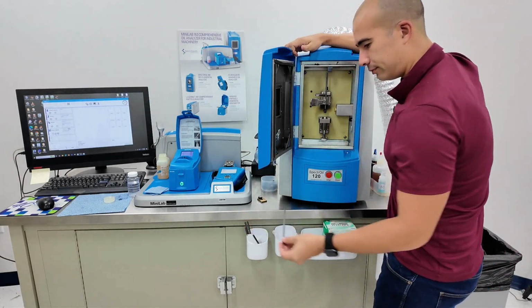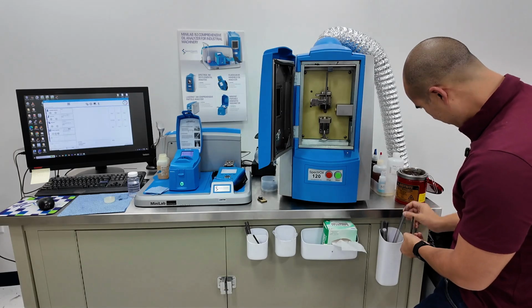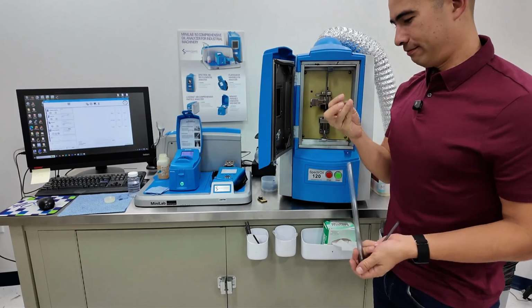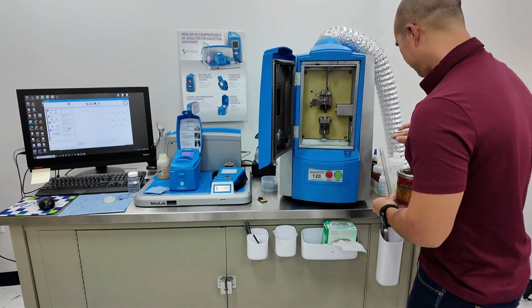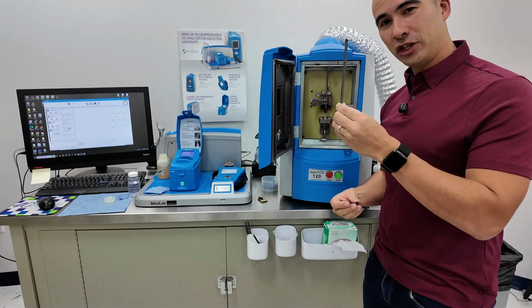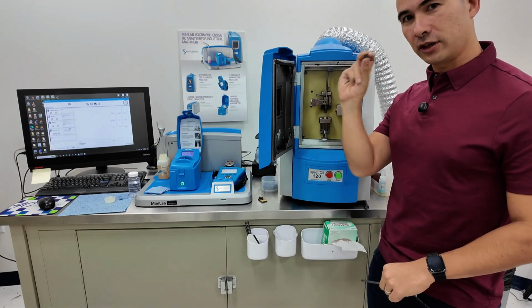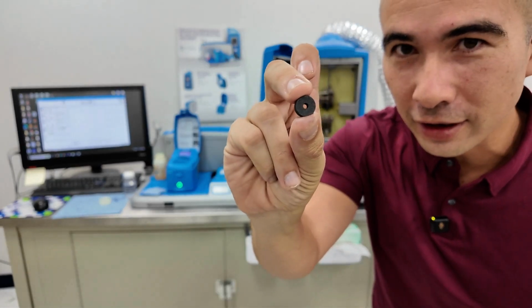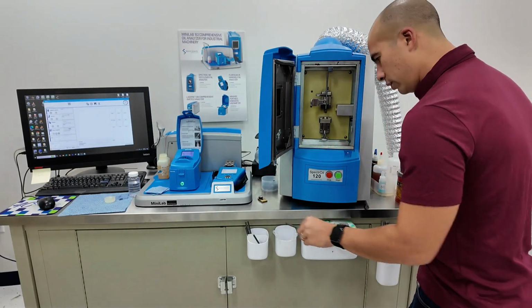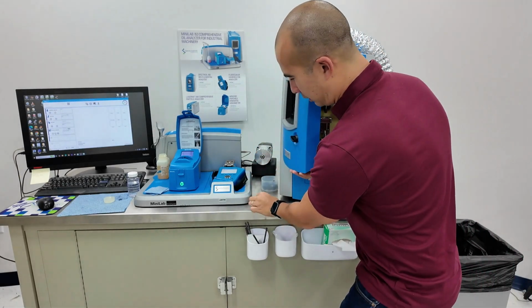I can get one of these out. Okay. A couple of things. These need to be sharpened right before they're placed in the holder, and these are a consumable. So this is one-time use. If you want to have a little look at it, there you go. Hopefully it focuses. These are one-time use and are discarded after the test. So what you want to be doing, just put that here for the moment, is, okay, we've got everything set up except for the actual oil sample itself.